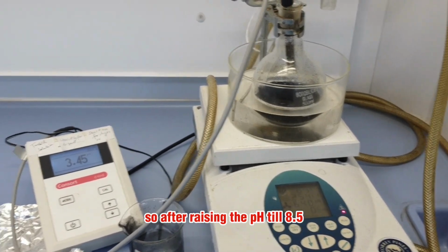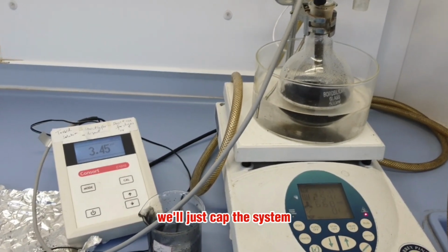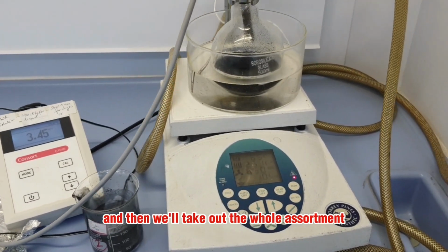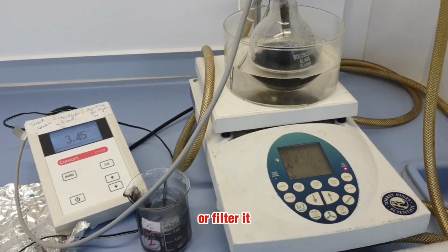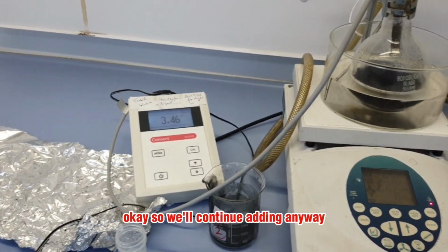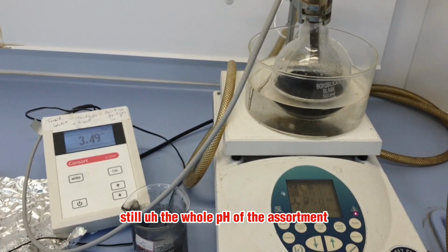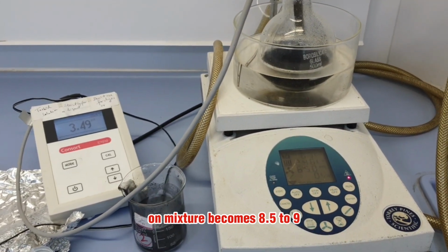After raising the pH to 8.5, I will cap the system and wait for around 24 hours, and then we'll take out the whole assortment and centrifuge or filter it. So I'll skip this step. We'll continue adding NaOH until the pH of the mixture becomes 8.5 to 9.